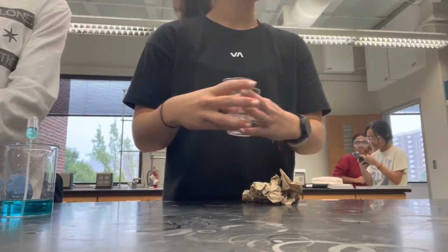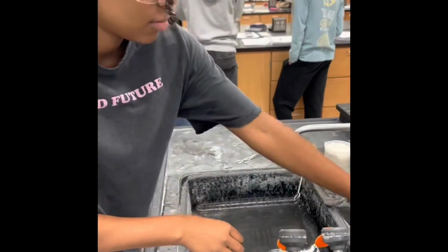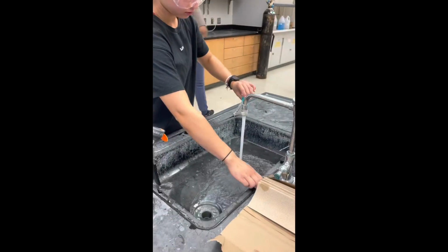that was dyed blue. When increasing the volume of the stock solution to a mixture, the concentration increases. Likewise, when increasing water or the dilution, the concentration will decrease but the volume will increase.